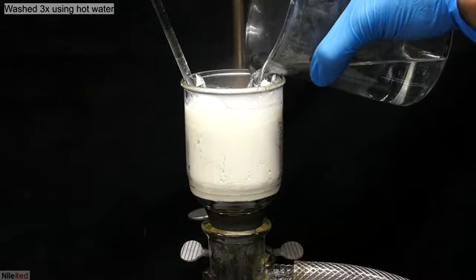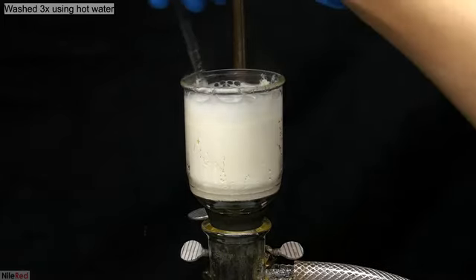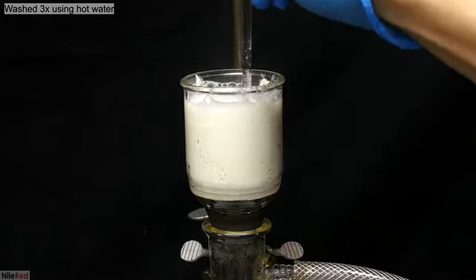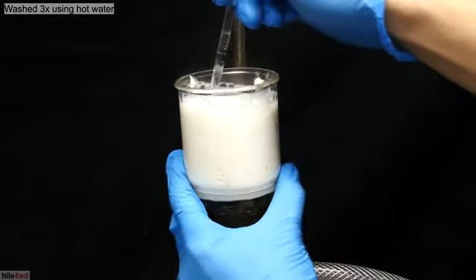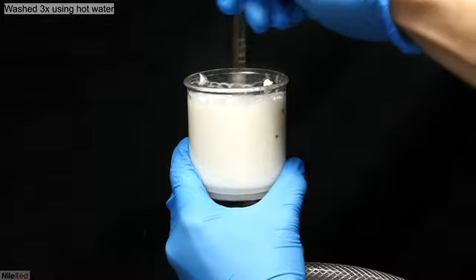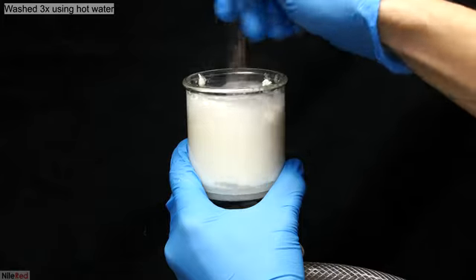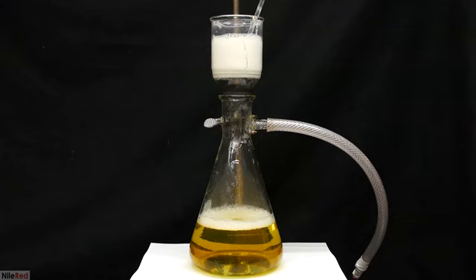I only needed to do this a couple times until the beaker was pretty much clean. I then added some hot distilled water, and using the glass stir rod, I thoroughly mixed things up. Once I felt like I had given the calcium citrate a good wash, I turned on the vacuum and pulled away the water. This washing step is used to clean up the calcium citrate, and I repeated it 2 more times for a total of 3 washings. The filtrate below has a pretty strong orangey yellow color. The pH of this waste is close to neutral, and there's nothing toxic or dangerous about it, so it can just be poured down the drain.